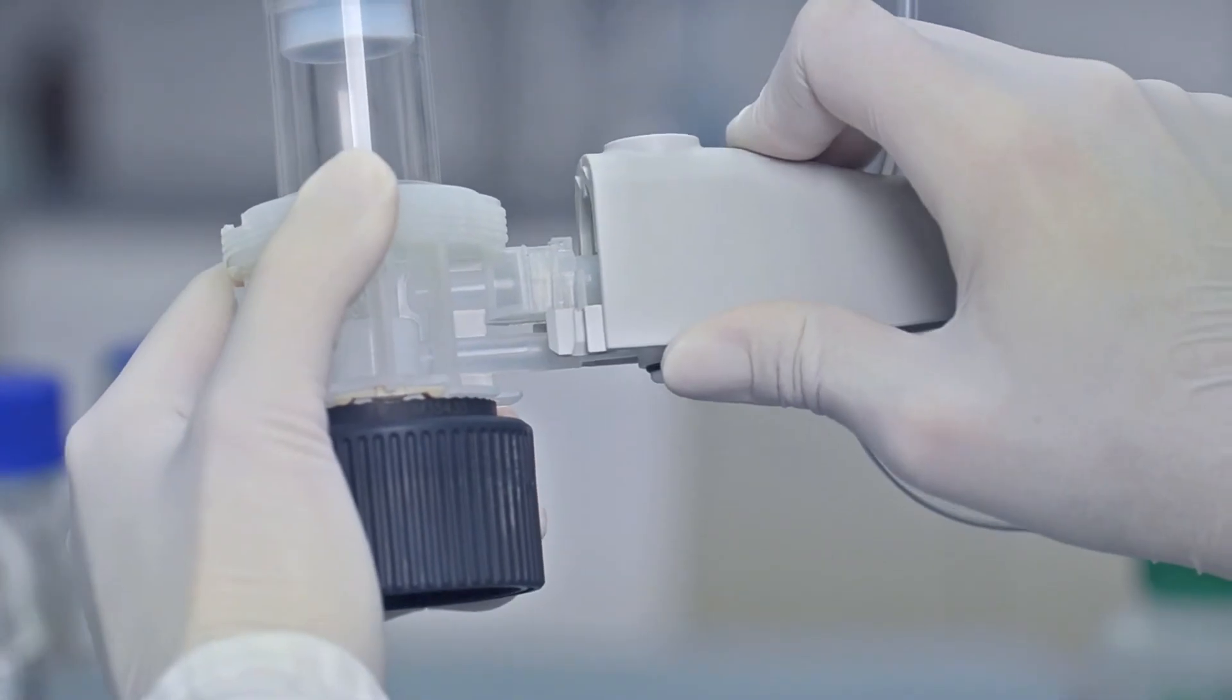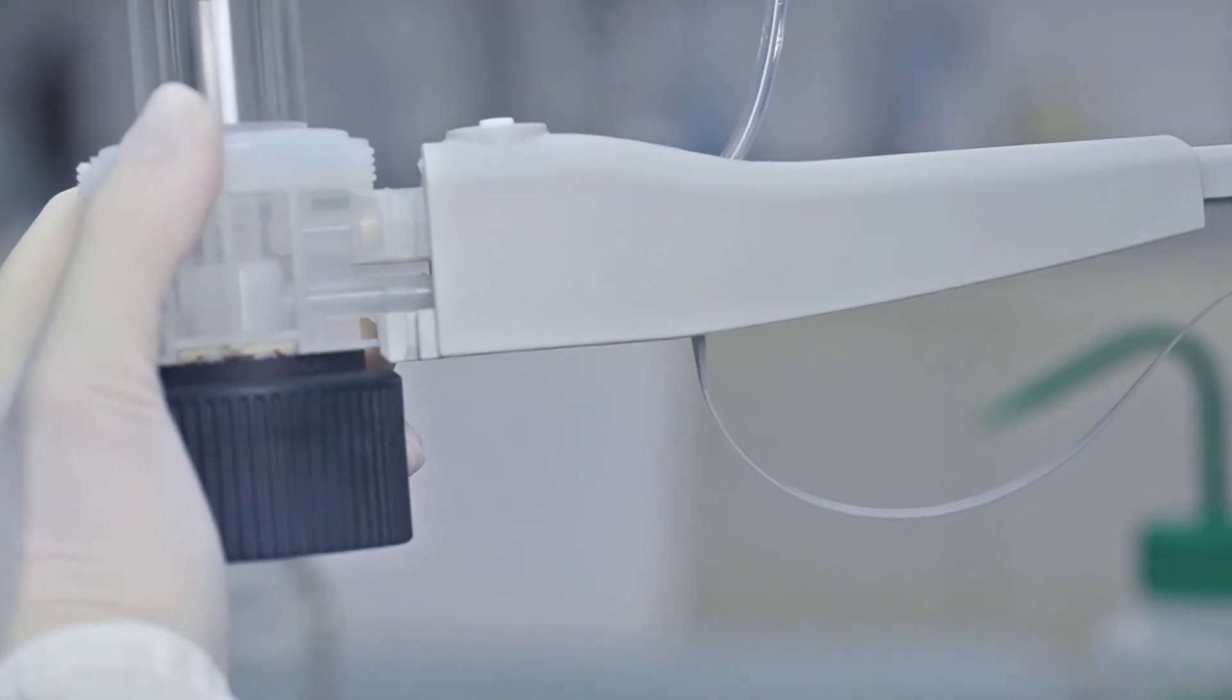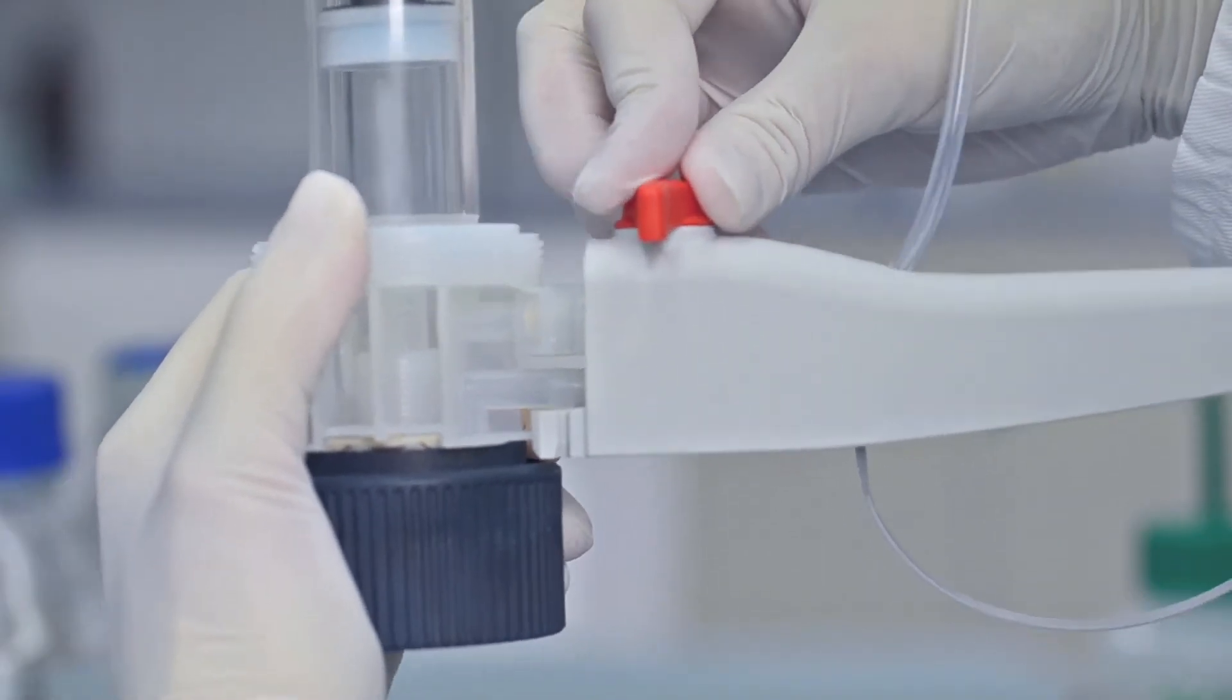Slide the clean titrating tube in as shown. Now press firmly on the valve lever.